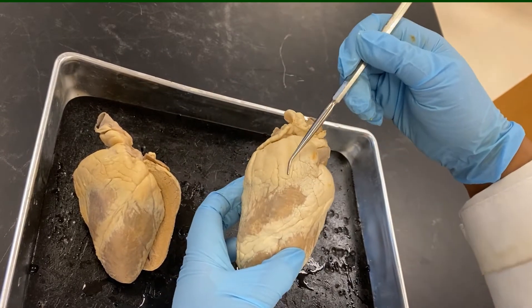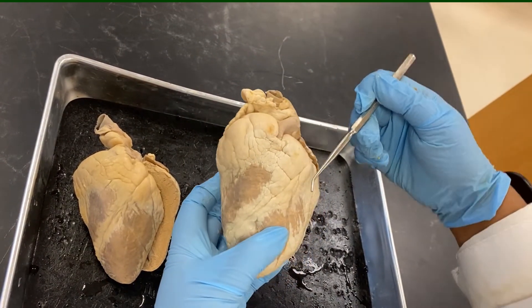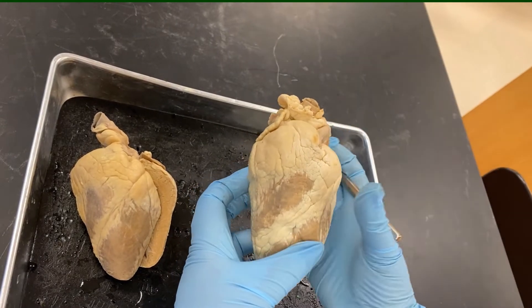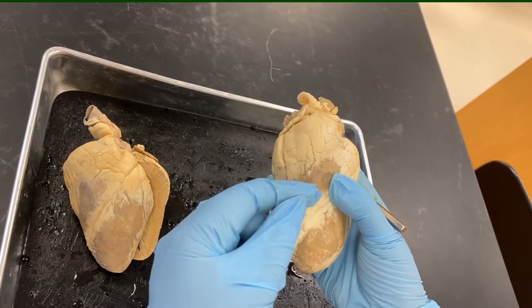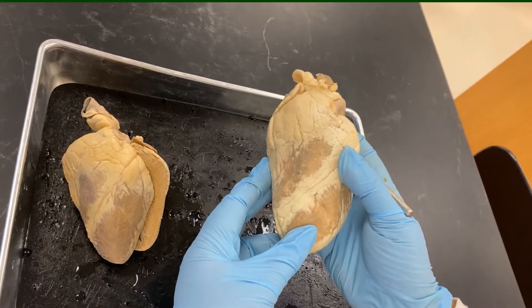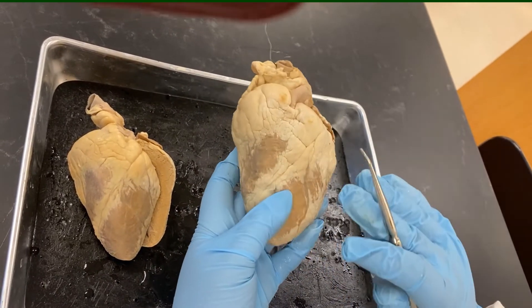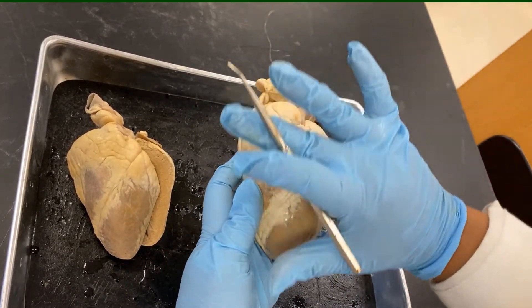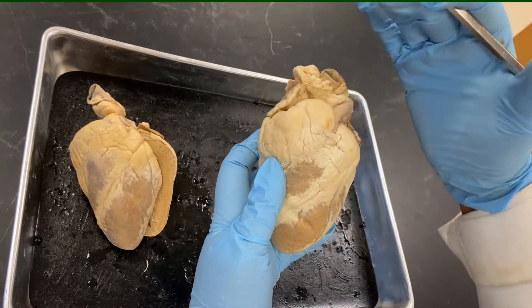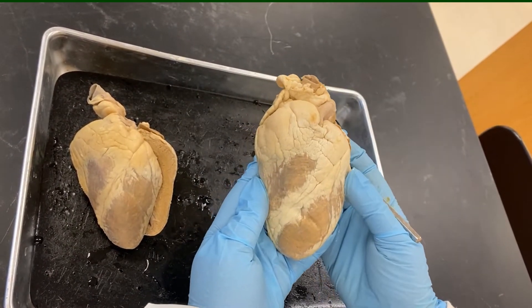You can see the fat tissue layer which covers and protects the heart. To get this view, we have removed the pericardium. Otherwise, the heart is protected within the covering that is the pericardium.